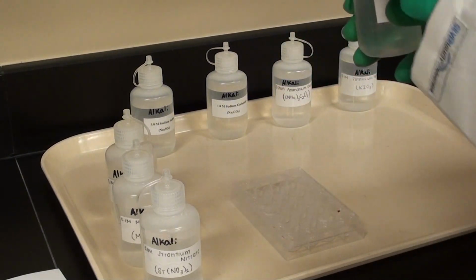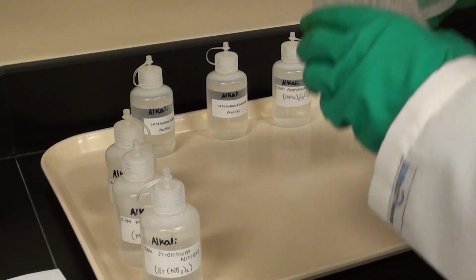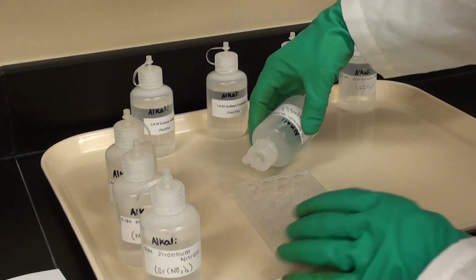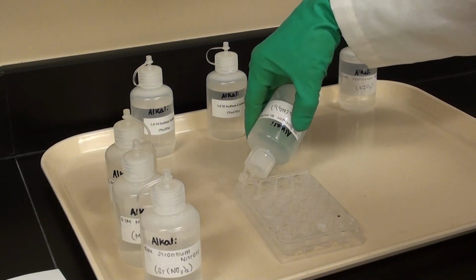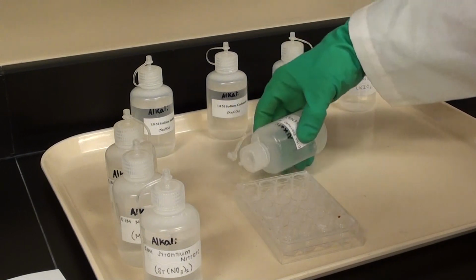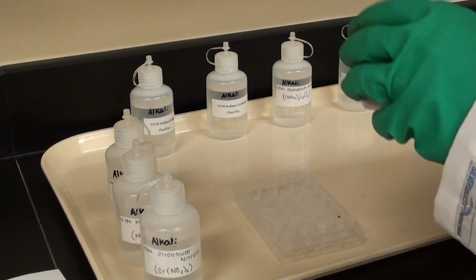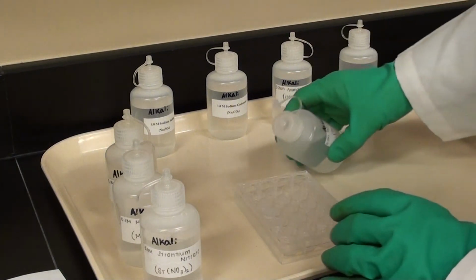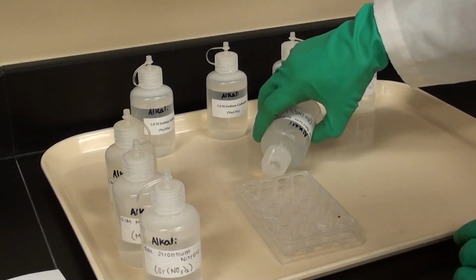So how much are you going to put into the well plate in each case, Jim? About halfway? Maybe halfway, yeah. It's not super critical, just try to be consistent. So maybe a third to half of each well, and just go across each one. That's about 15, 16 drops, give or take. Let me repeat the same thing for this. He's going to do it across that top row.